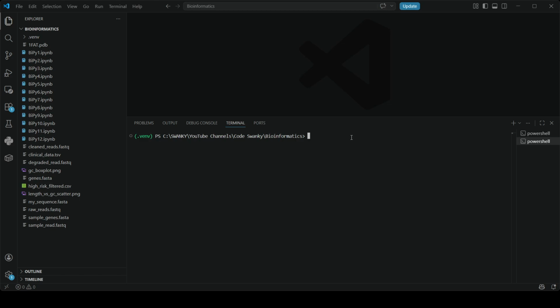FastQC sometimes gives you a beautiful green check mark, but often it gives you a big red X warning that your reads have low quality tails or are contaminated with artificial Illumina adapter sequences. So we cannot align contaminated data to a human genome, right? It will cause massive errors.